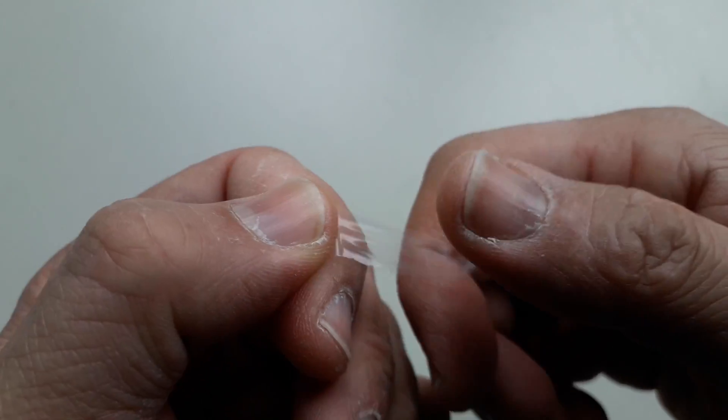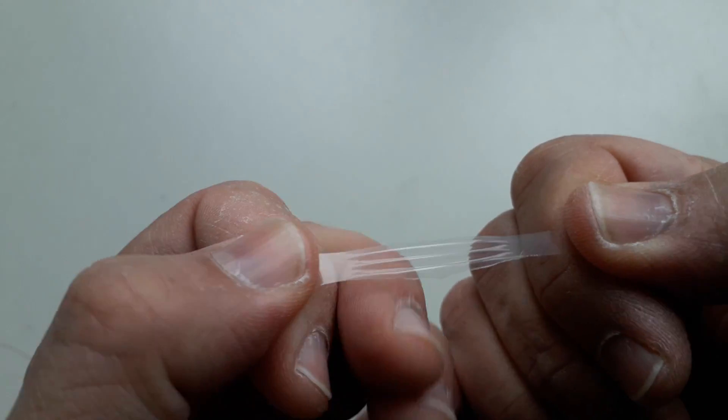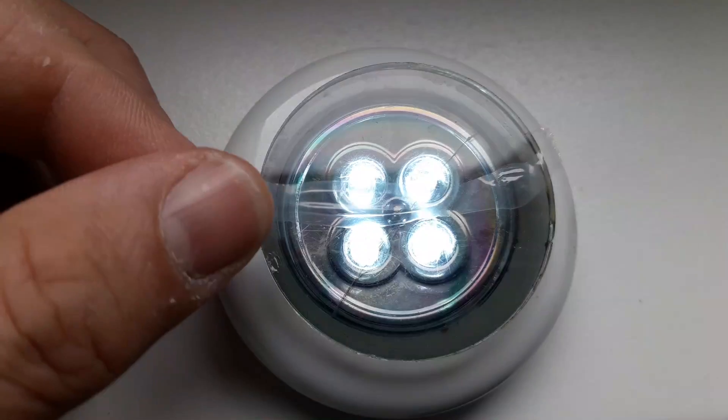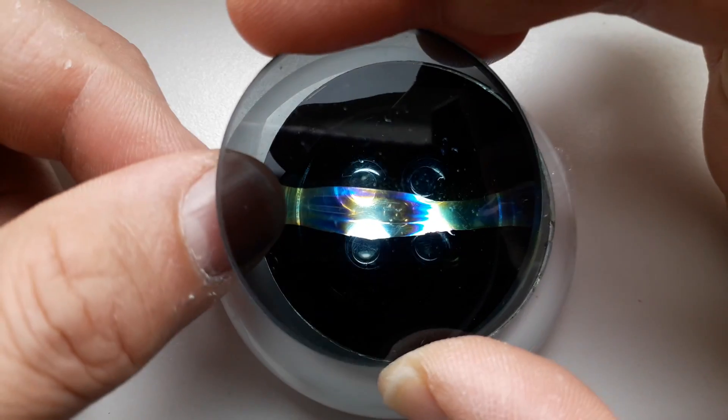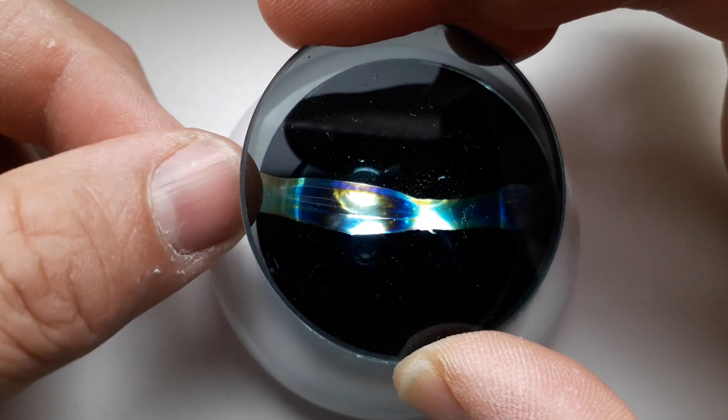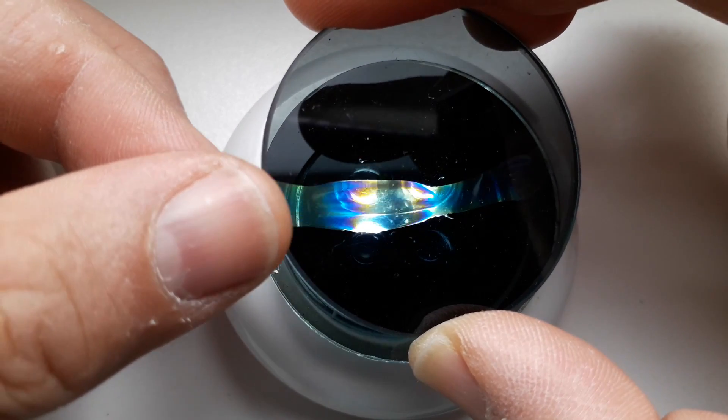If you have other plastic, then you have to stretch it a little bit and this also makes these colors appear because the tension in the plastic also causes the light to polarize.